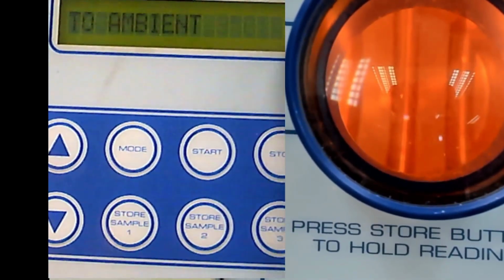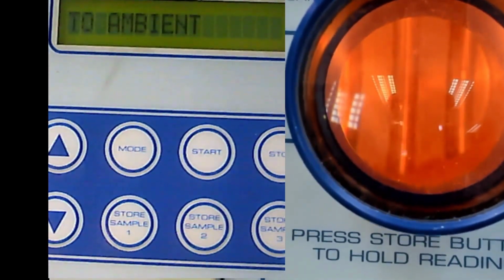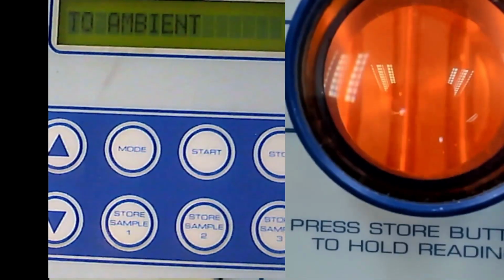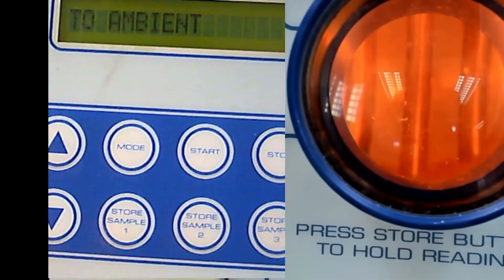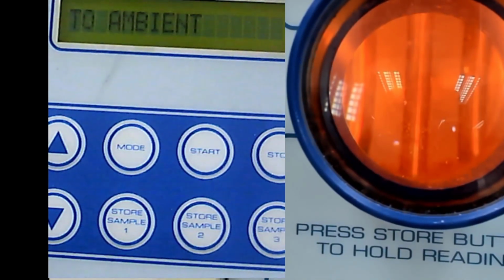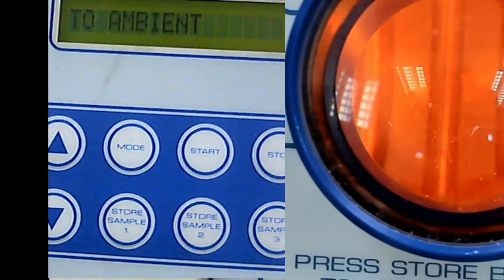This is the problem with online teaching, because you need to set up so that it's clear for you. I mean, if you are in the lab, you can simply see it, because your eyes are much sharper. You can see with your eyes. Let me set.